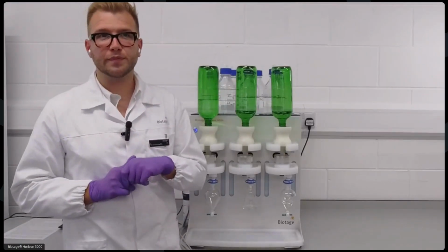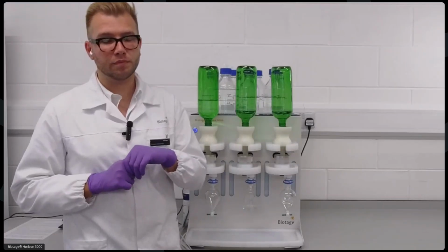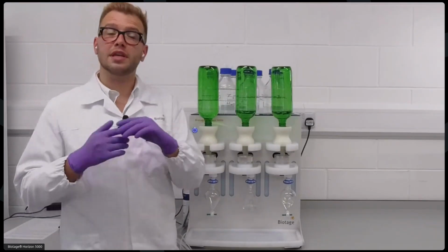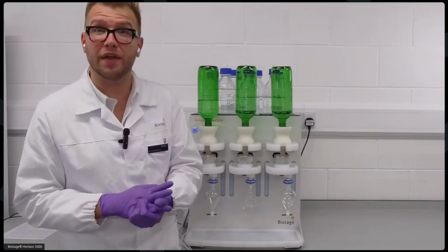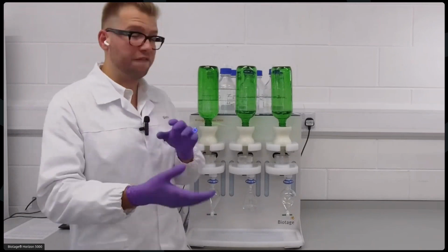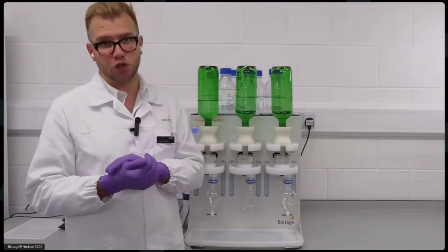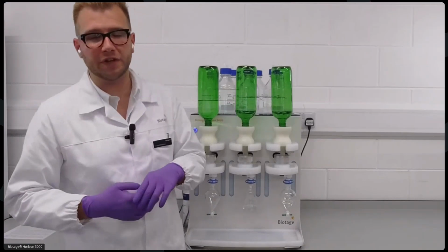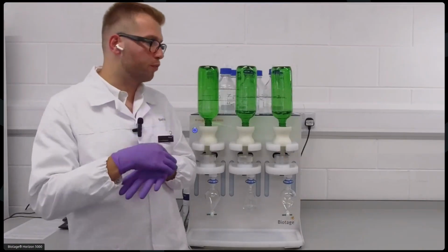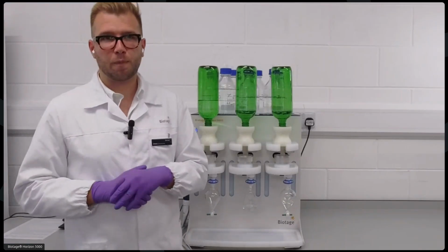Thank you, Wayne. We have a question on, is there any water left after the extraction in the flask? So that will depend. Yes, you will always have some water on the disc, and this is where the drying time is very important. But with efficient drying, this can be kept to a very minimum, and your final extract will not contain water, or it will be a very insignificant amount. Now, if this is something that's very detrimental, then we can incorporate the use of sodium sulfate and things like that to dry your extracts. Thank you.